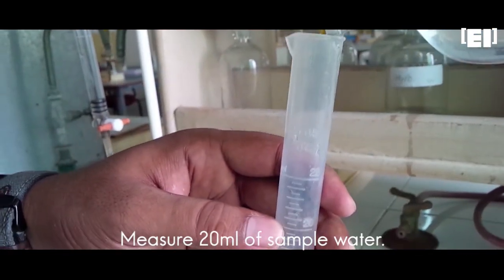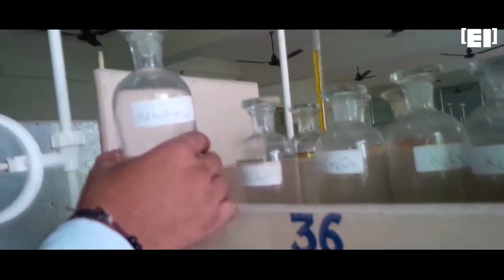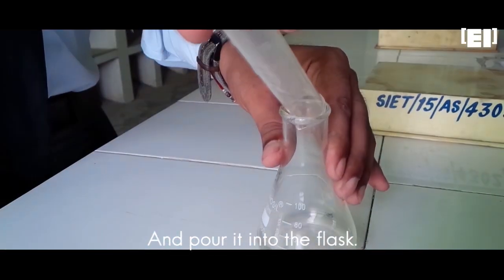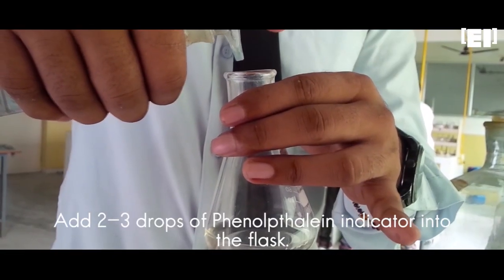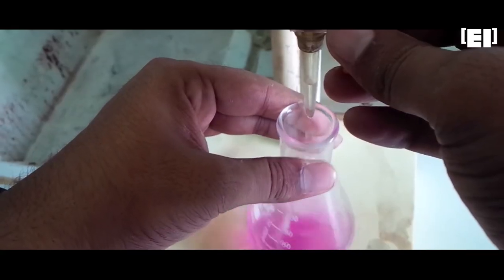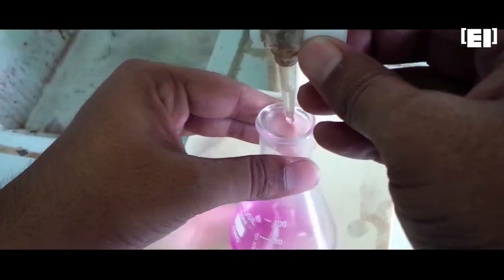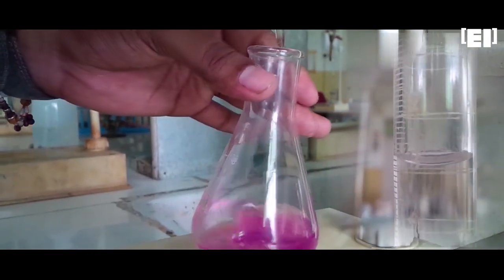Measure 20 ml of sample water. And pour it into the flask. Add 2-3 drops of phenolphthalein indicator and put the flask below the burette and open the stopcock. Titrate the solution with constantly shaking the flask. While shaking, keep an eye on the burette scale.